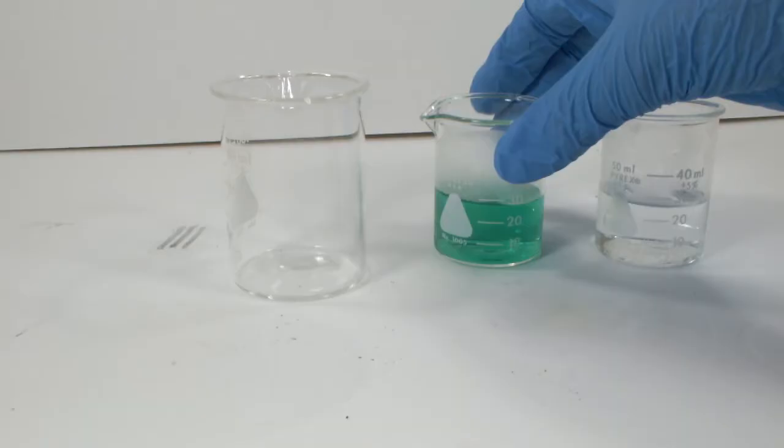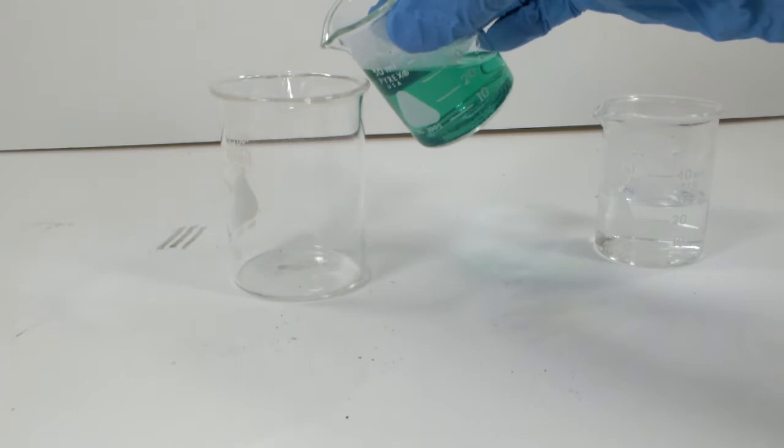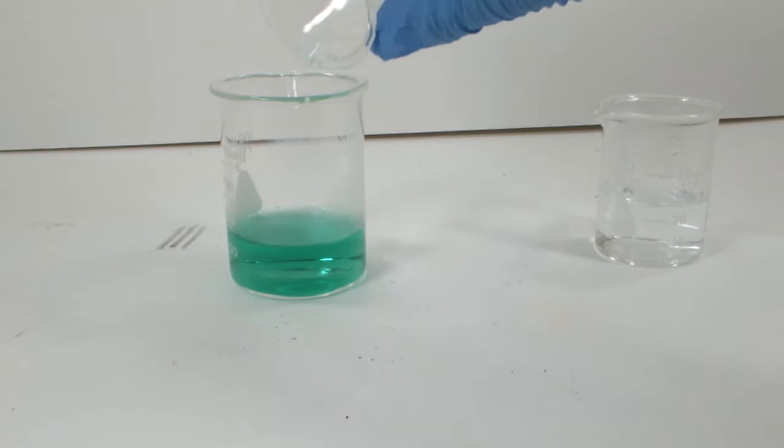After some gentle heating and a little patience, we're ready to go. Since I used more water than I originally intended, I'm going to transfer everything to a slightly larger beaker.